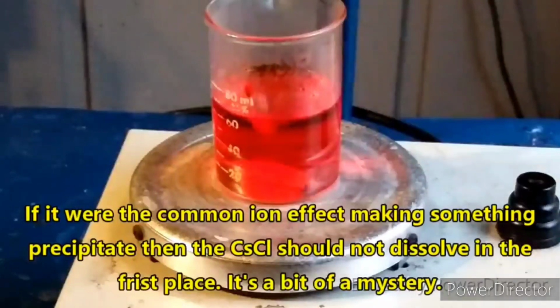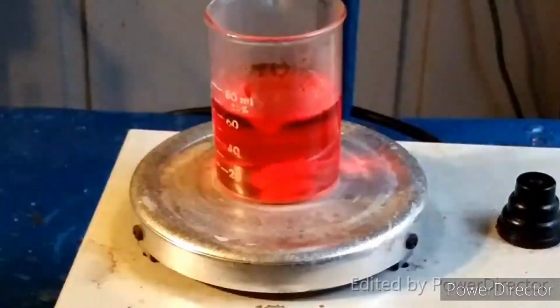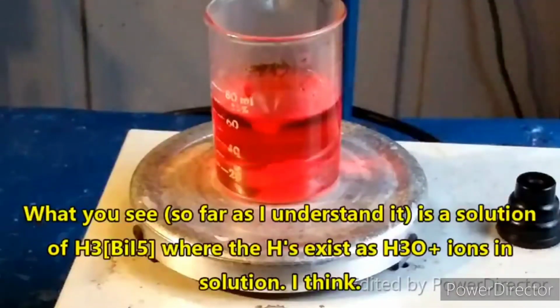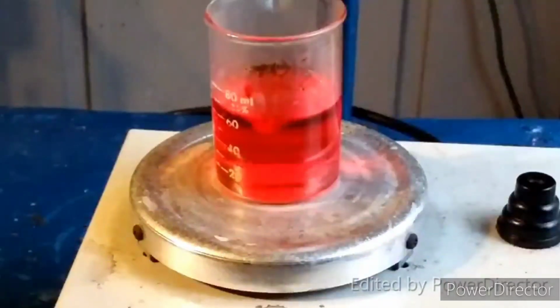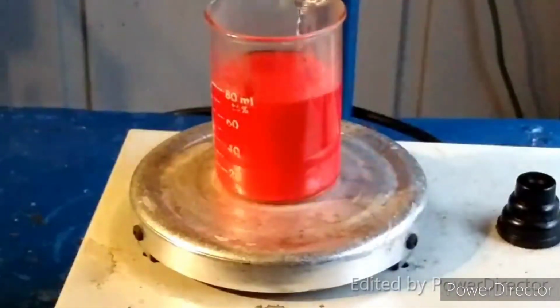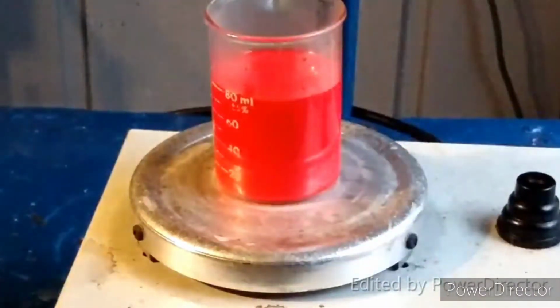Alright. Now, this will be the acid bismuthate, at least based on the stuff that I was reading. That looks to be the case. Alright, so now what we're going to do is add the cesium chloride to this. And that precipitates out our product.